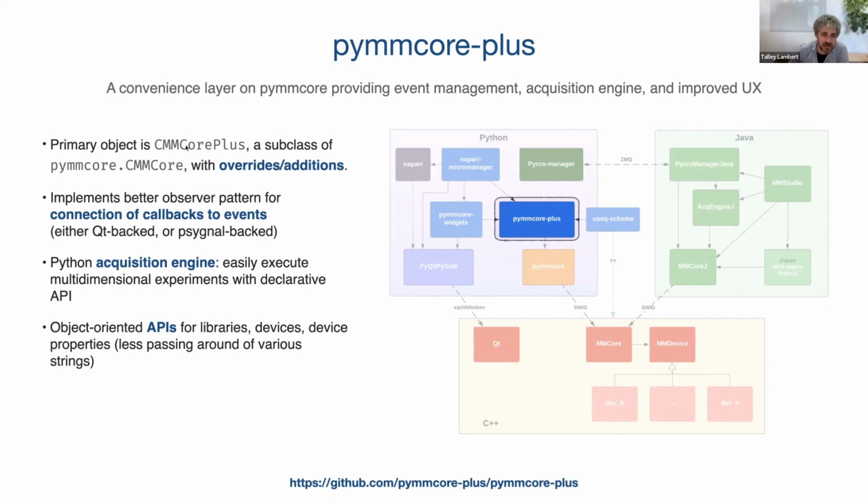So the primary object really is just a subclass of the main object in Core. CMM Core Plus is the main object in this library, and it is a subclass of CMM Core with a bunch of overrides and additions. I have more on the next couple slides, but the summary here is that it implements a better observer pattern for connection of callbacks. So if you want to spy on the state of the microscope, the core object, and then call functions in response to various events, it implements a more familiar pattern for that, either using Qt or psygnal, another library for the observer pattern, which is something like connect my callback, and then when that thing happens, your callback gets called.